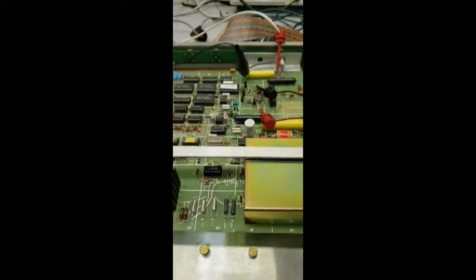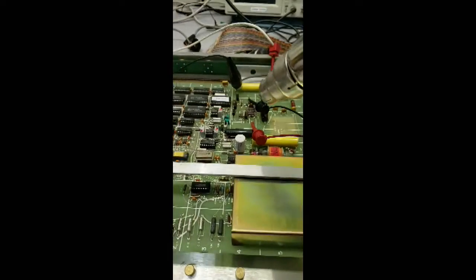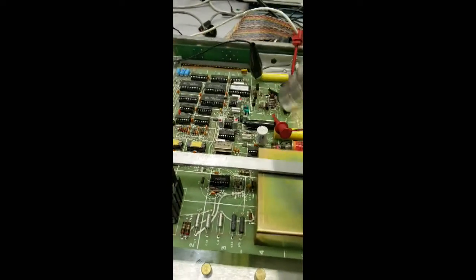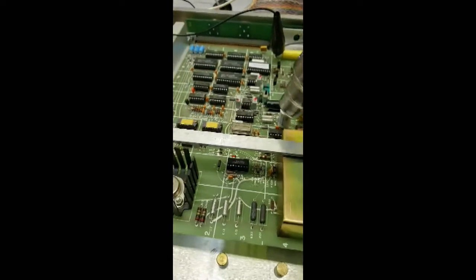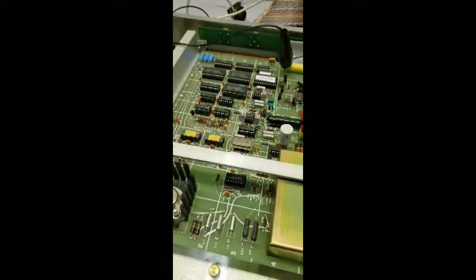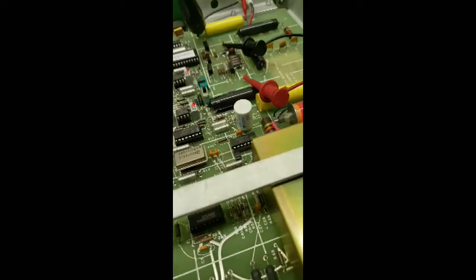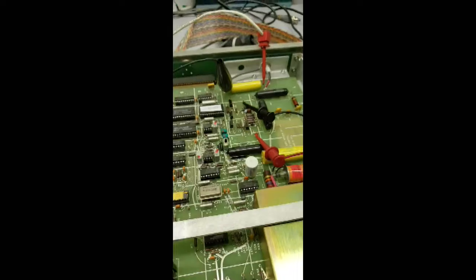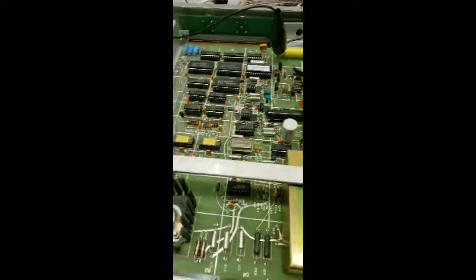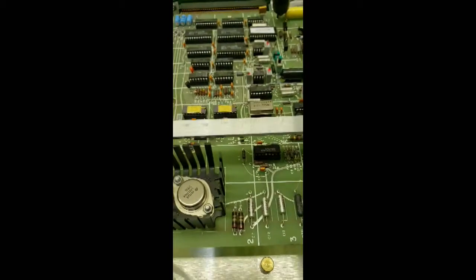Let's try to find which component we can heat up to cause this problem. Somewhere over here. Looks like this LM339 maybe. Now I'm going to take some cold spray and try to cool the component down. Oh, sometimes you've got to be fast. Okay, here we go again. Let's try to confirm. I'm going to heat it up.